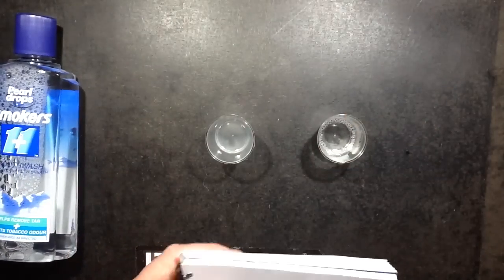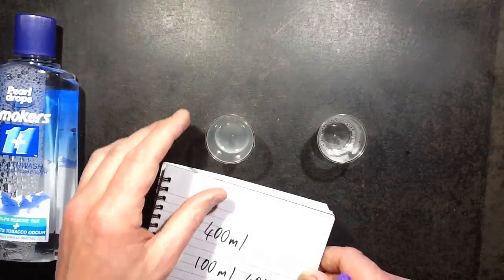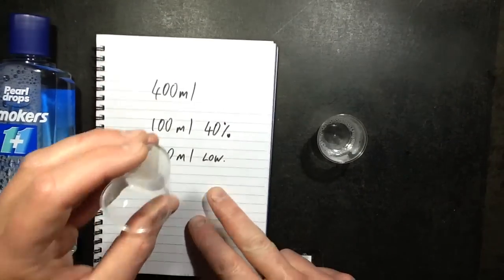And the liquid just looks like slightly bubbly water, so I'm just going to taste it and tell you what they actually taste like.